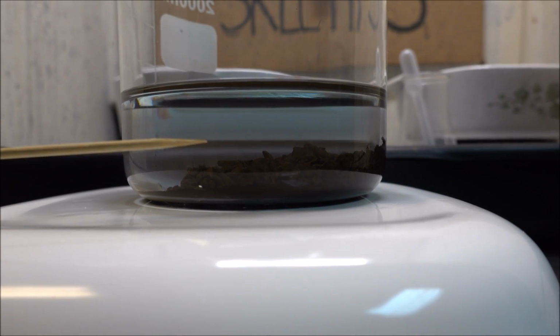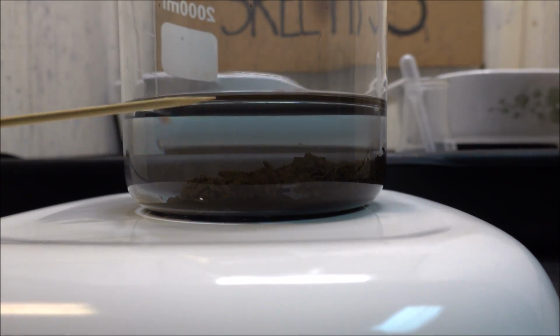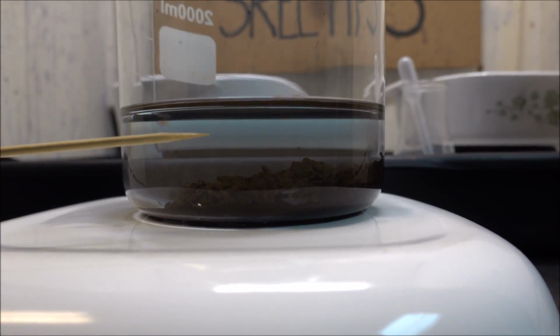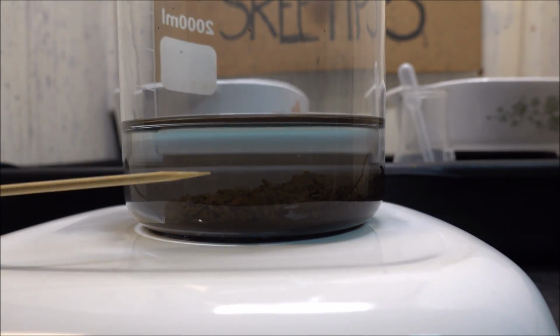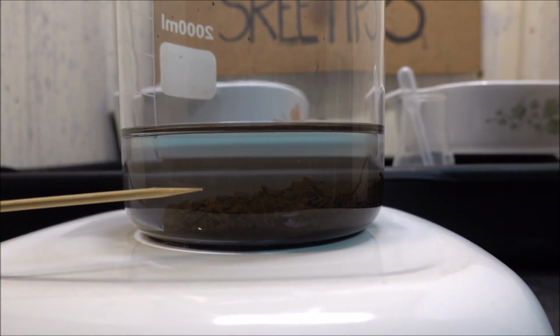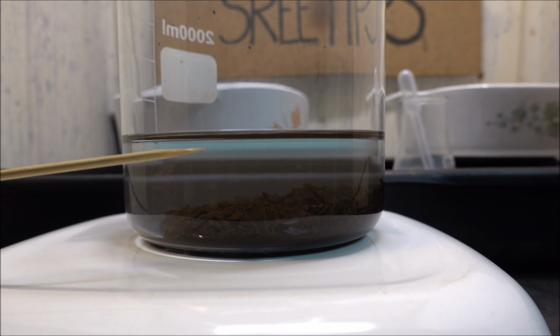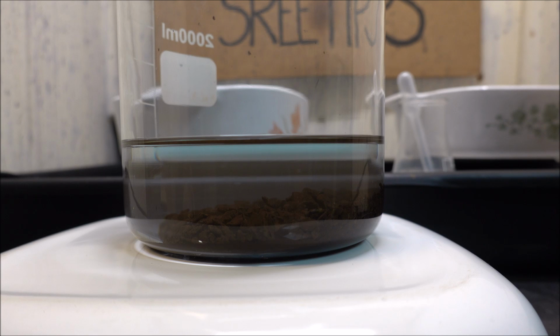It's been about 6 hours since I removed the inquarted gold from the heat, and as you can see, there's still just a tiny bit of suspended gold in here. I think it's going to be okay. I'm going to go ahead and draw this off now. This is the big disadvantage that happens when we add too much silver. It just slows everything way down.